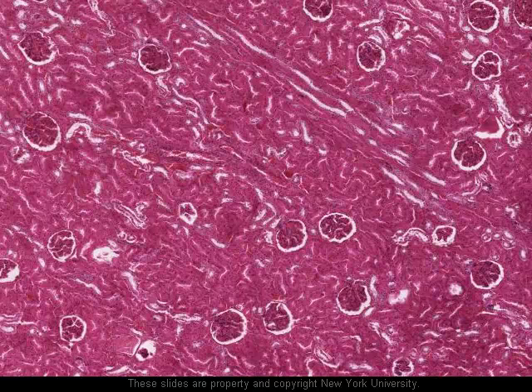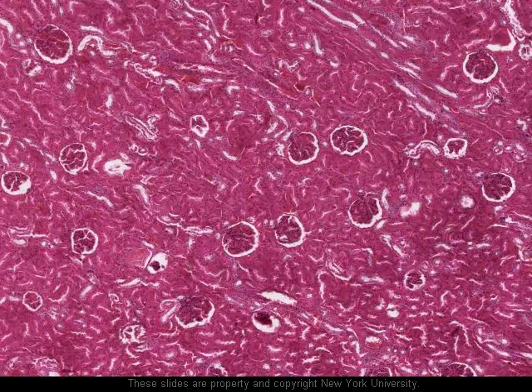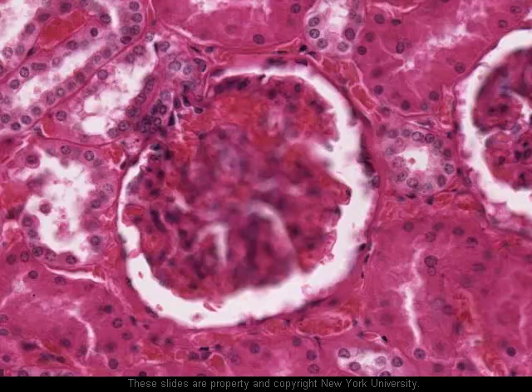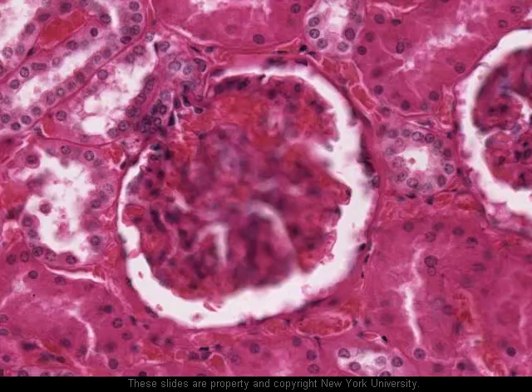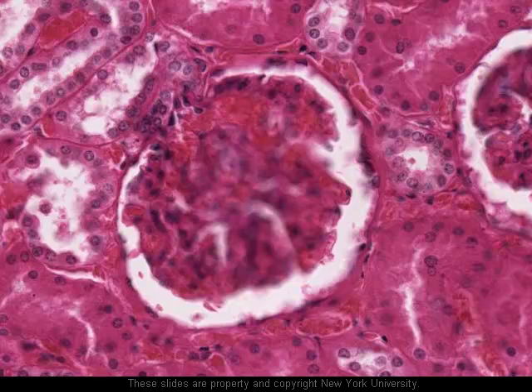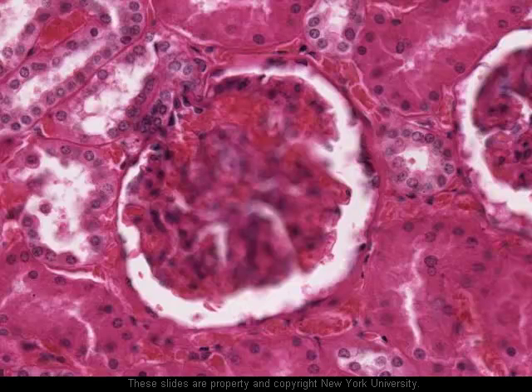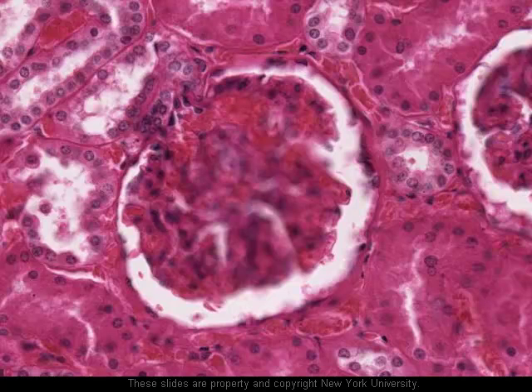So now let's go to higher magnification and take a look at some of these glomeruli and see if we can make out any interesting features. Here we've zoomed in in the cortex into a region where we can see a glomerulus here. Much of this glomerulus is out of focus because this section is quite thick, but broadly the glomerulus is this structure here. Although we can't make out the individual capillaries, we can certainly see the red blood cells — erythrocytes — that occupy those capillaries. The nuclei associated with these capillaries form the visceral layer of Bowman's capsule, and these nuclei belong to either podocytes or mesangial cells; in the light microscope it's not really possible to make out the difference between those two.